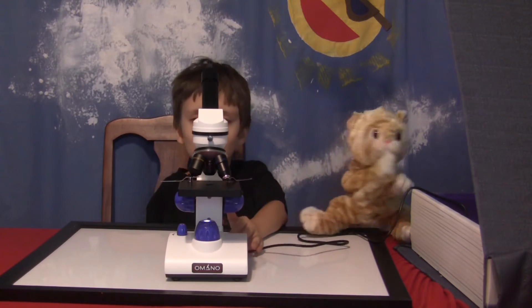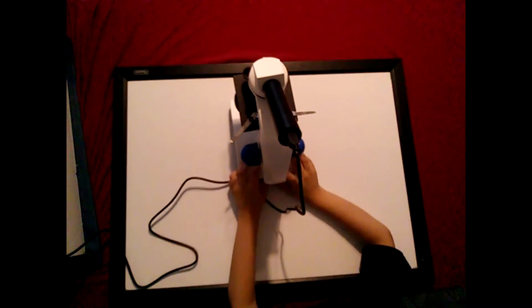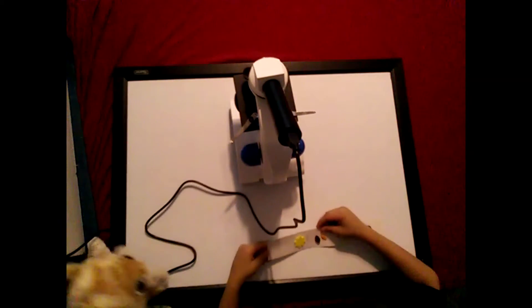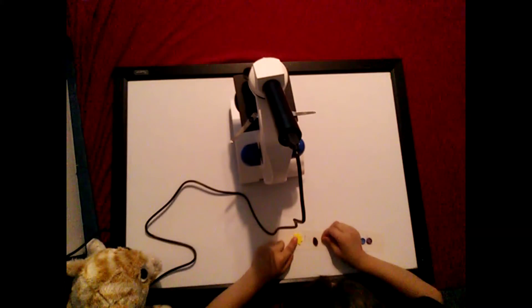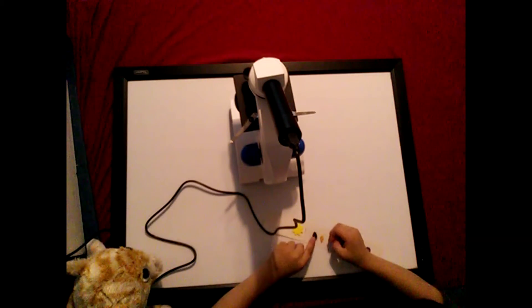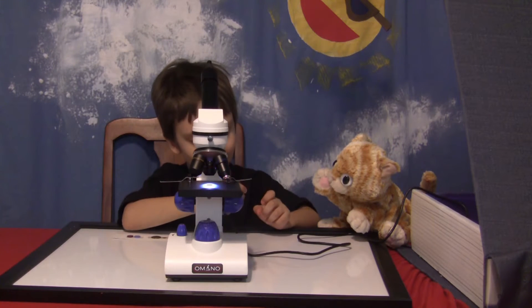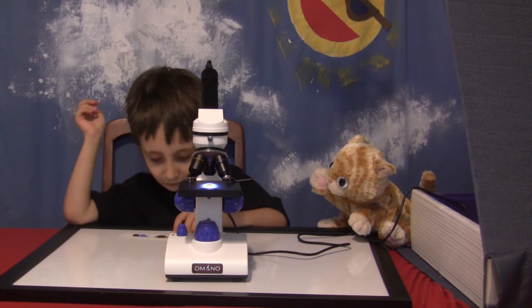I think turn on the overhead light because this doesn't look like it's stuff that you see. What's on there? A flower kind of thing, a flower kind of background thing, and a raisin, and whoa, look at this! Did you take something out? What is it? I don't know. And glitter.